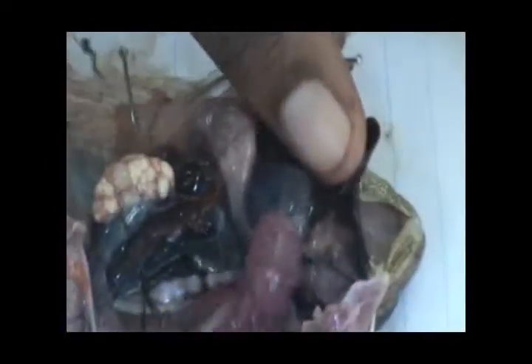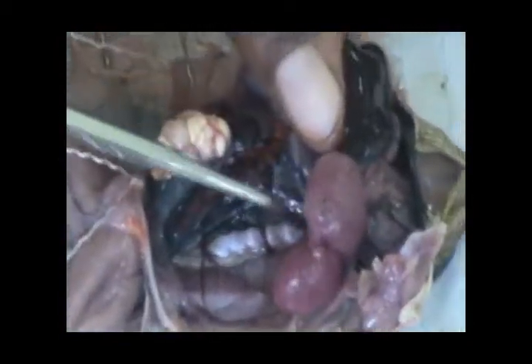When I displace to the left of the specimen, there is a very big blood vessel coming from the heart. This big blood vessel is called the aorta.